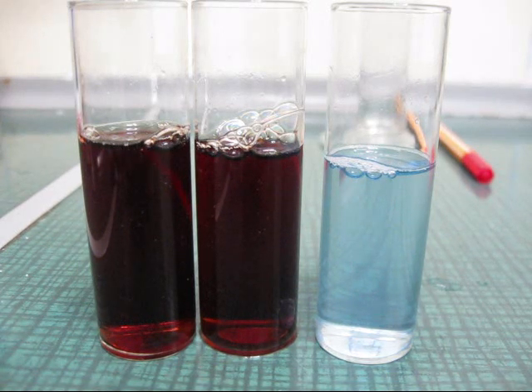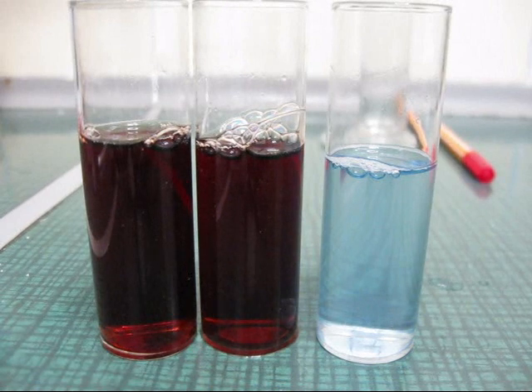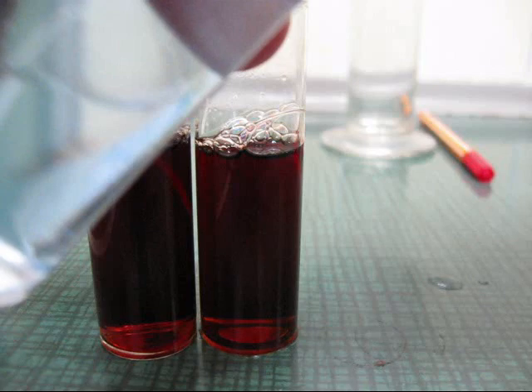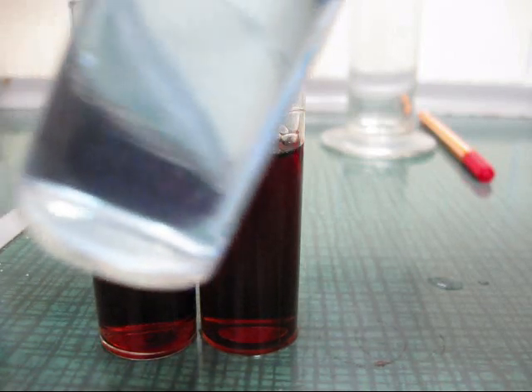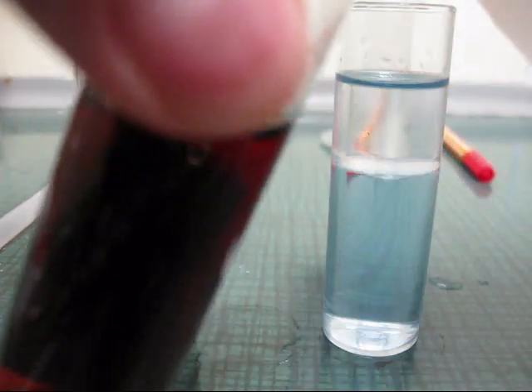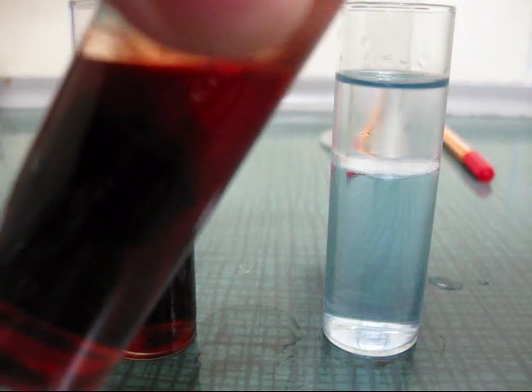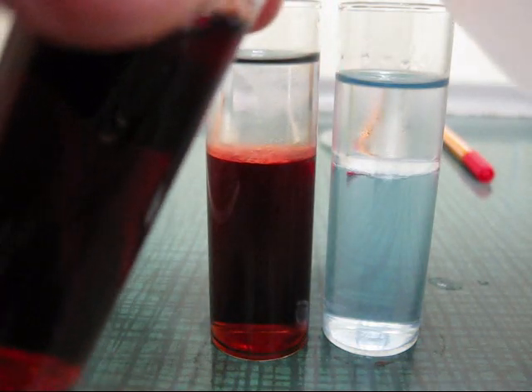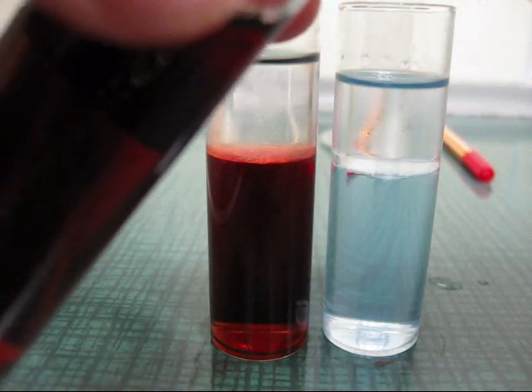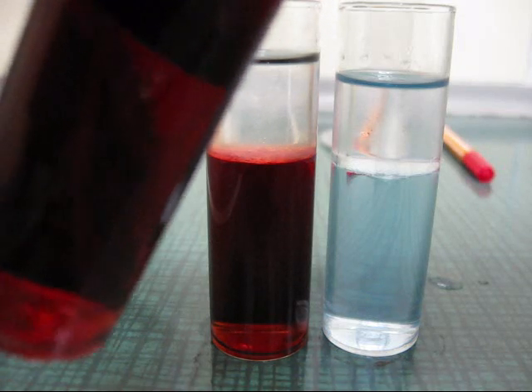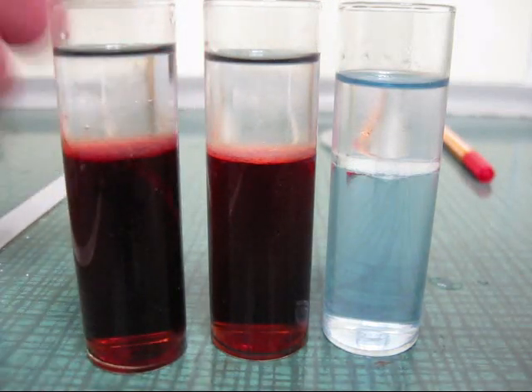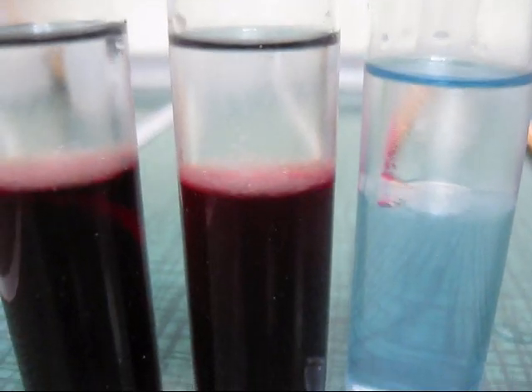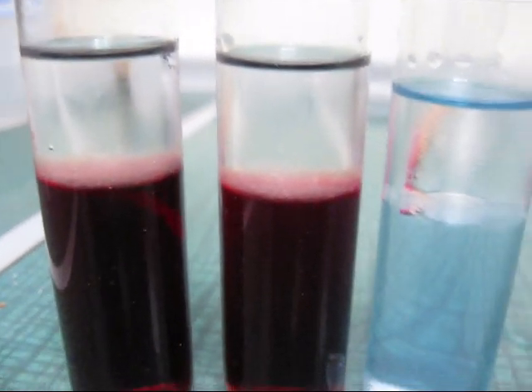By now pouring the alcohol on it. And that will be some ice cold isopropanol. It looks like it still works.